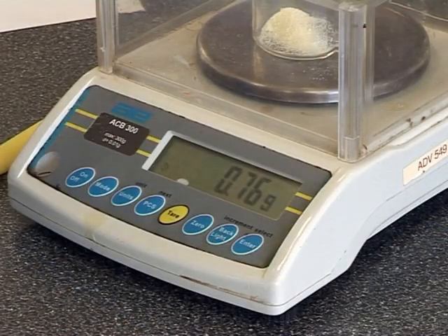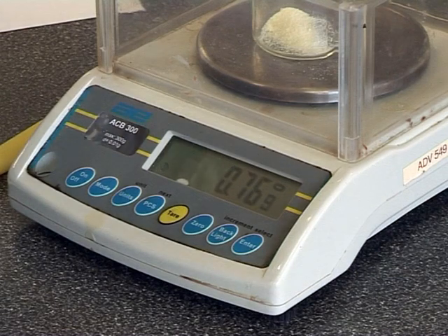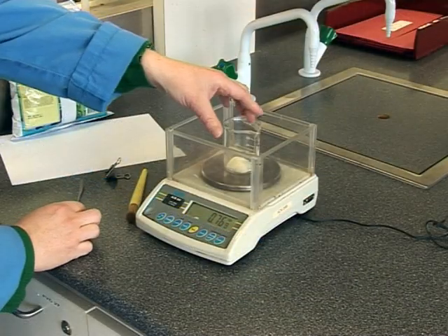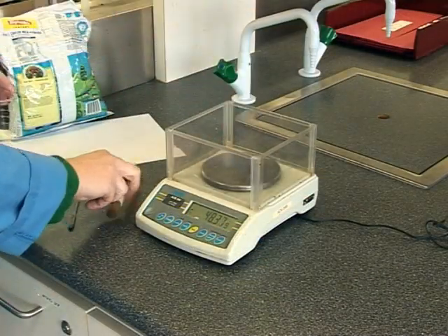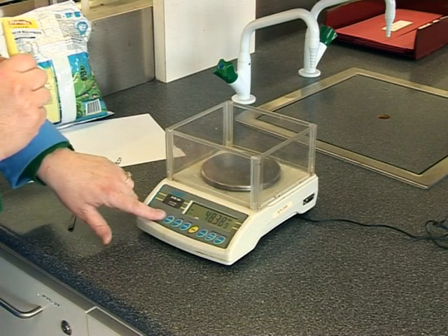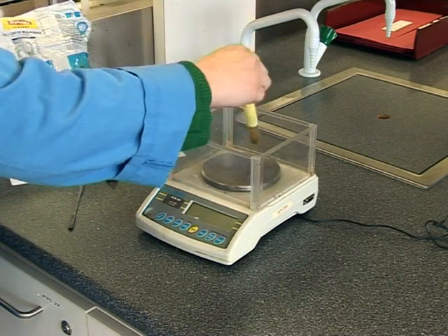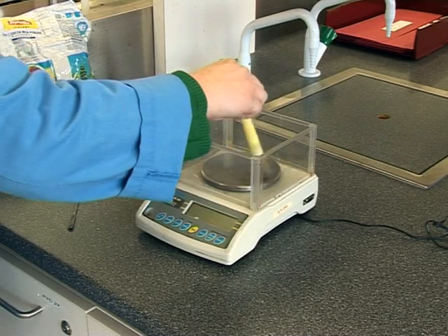Accurately record the weight of the analyte. Remove the beaker and ensure the balance is left clean. This is achieved by using a brush to sweep away any analyte that's been spilt onto the pan.